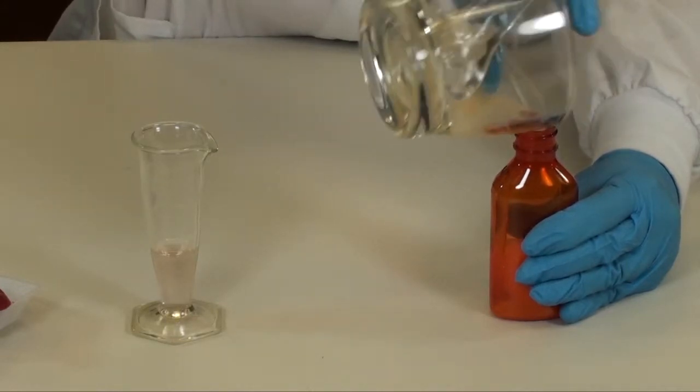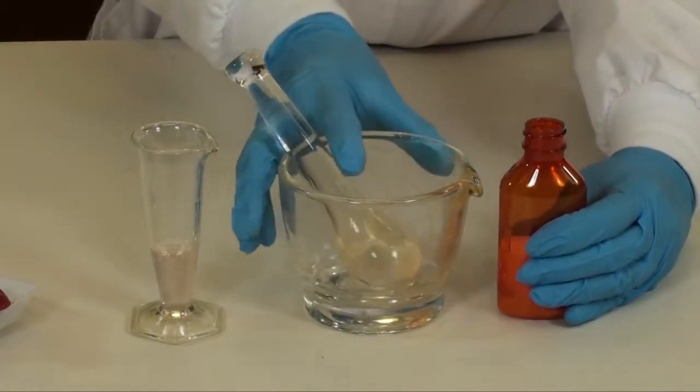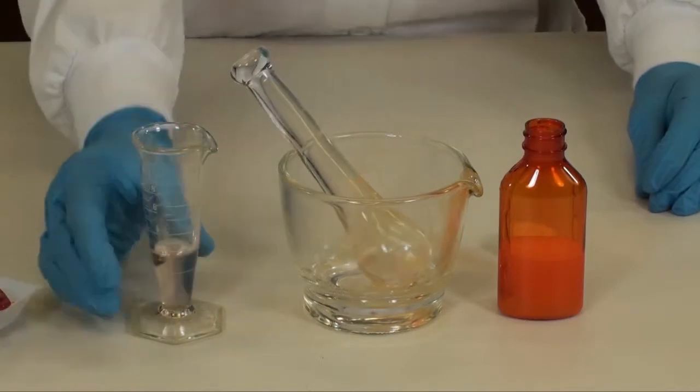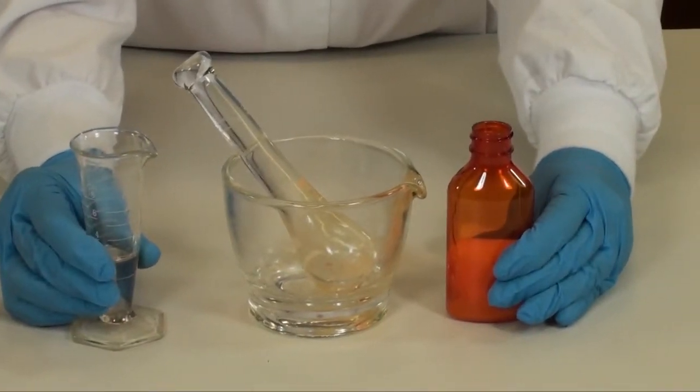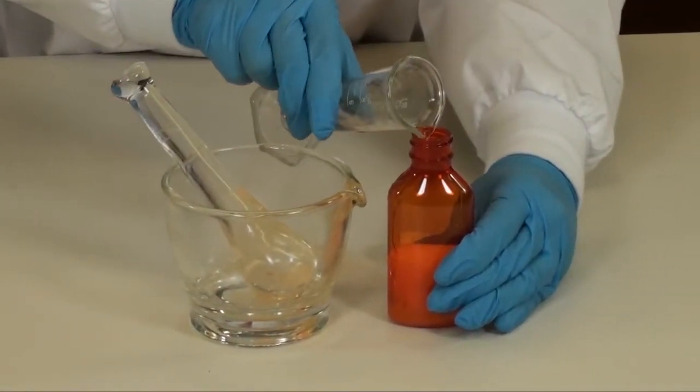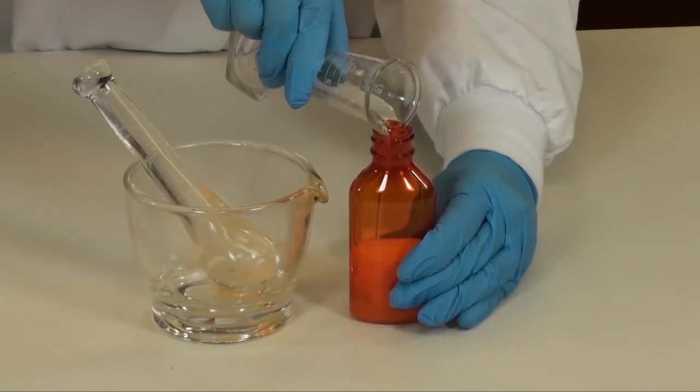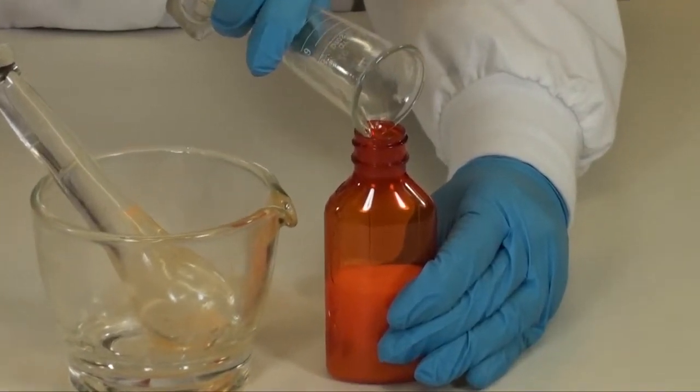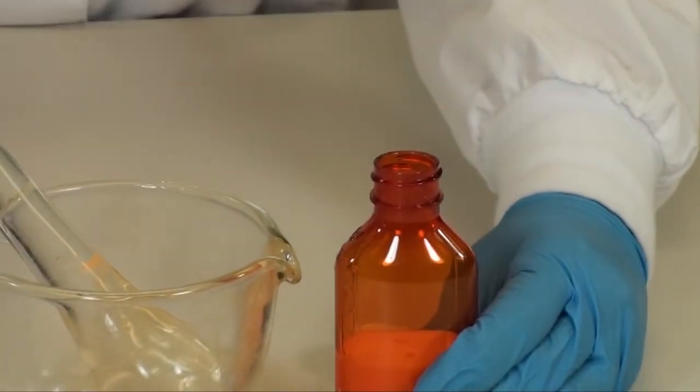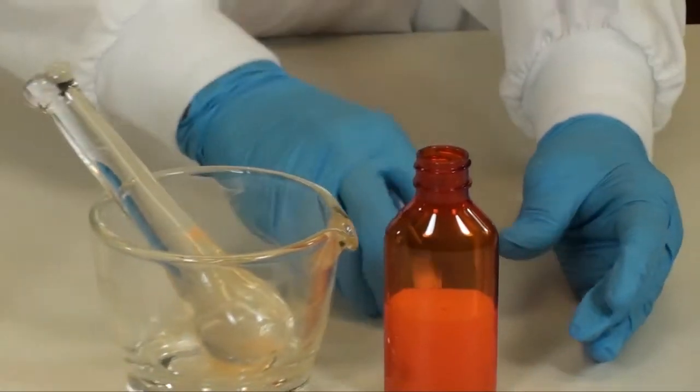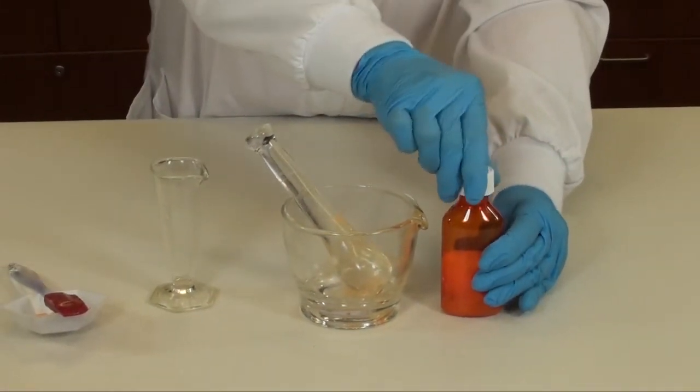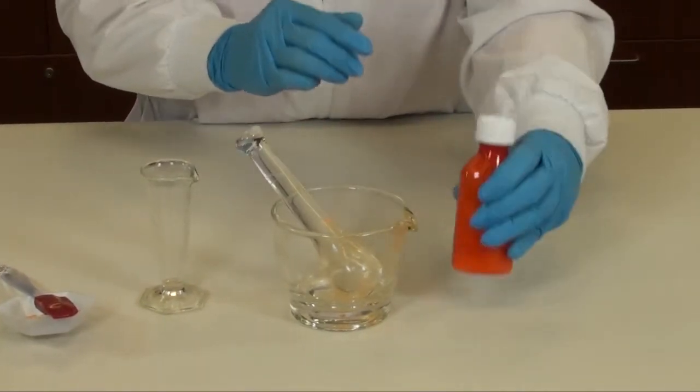Once you are satisfied that you've rinsed the drug thoroughly enough, you can QS to the required volume in your prescription bottle. Cap the bottle tightly and shake well.